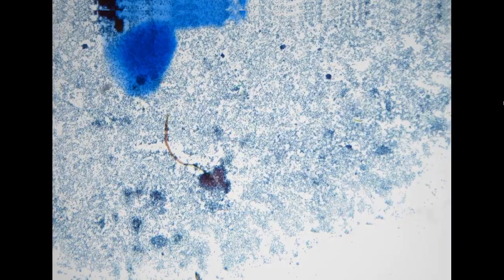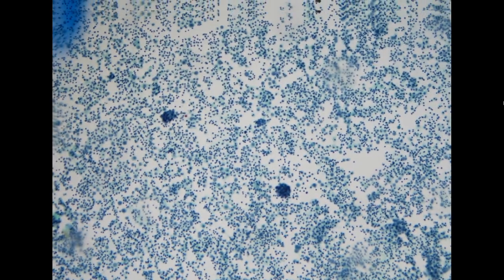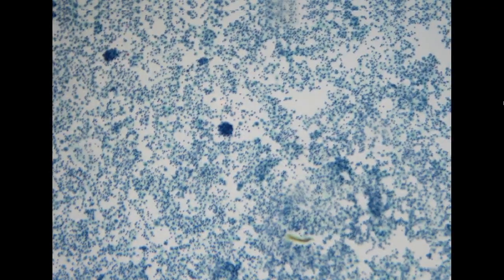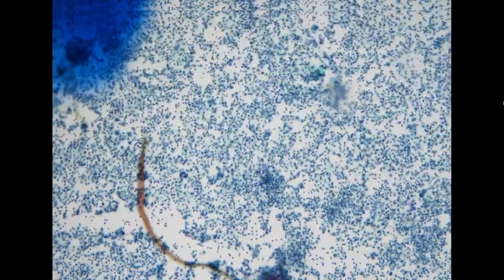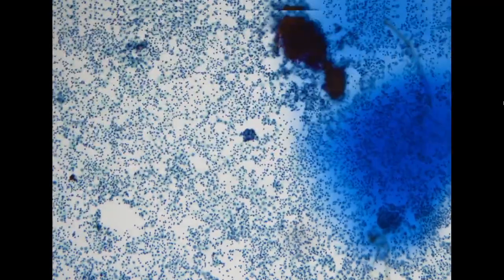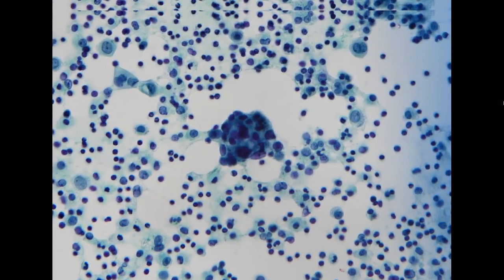So the next specimen, also from a female, the patient had an invasive ductal breast cancer. So different. The prior case is a lobular cancer, and this patient had a ductal cancer. For a ductal adenocarcinoma, it is more common that we can see a cannonball type of pattern. So we start to see these small tight aggregates of cells arranged in a three-dimensional ball.